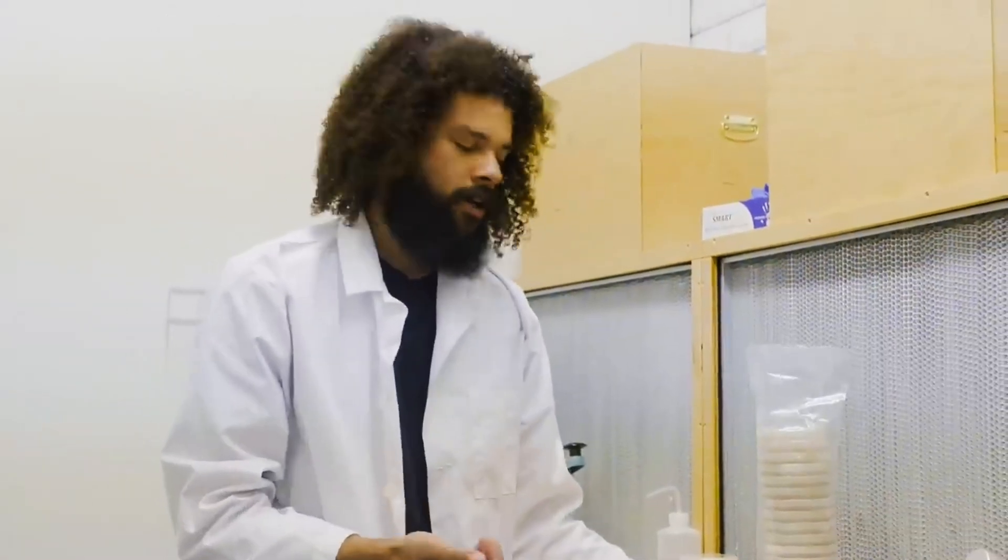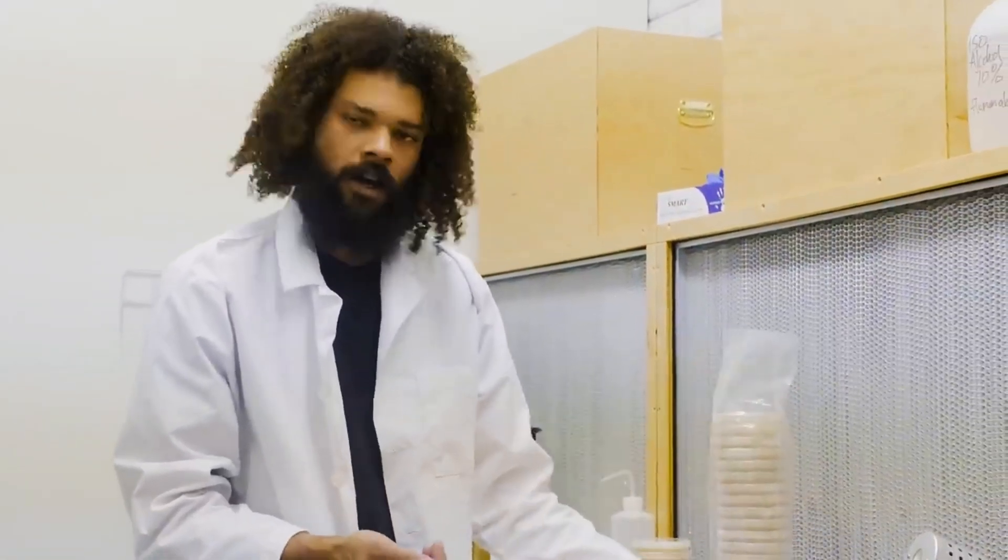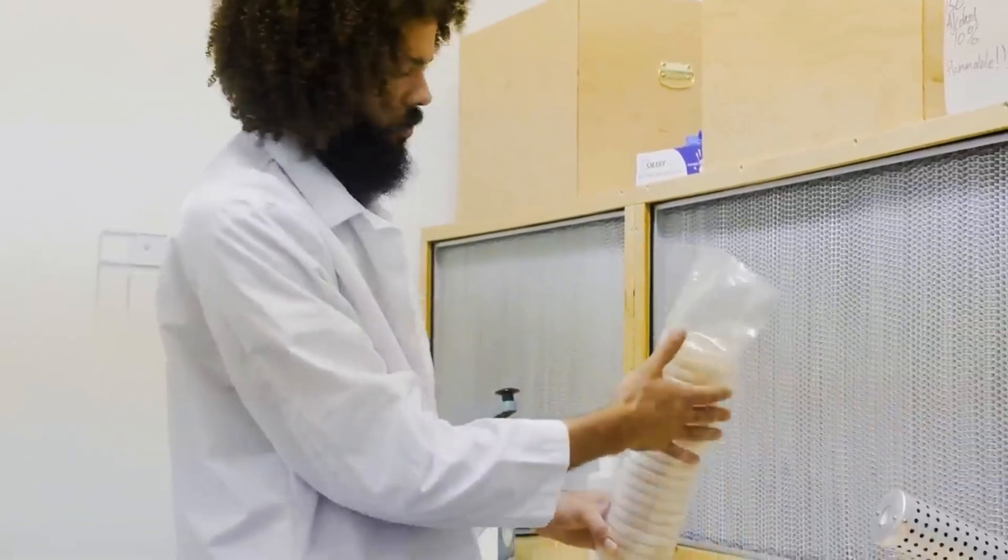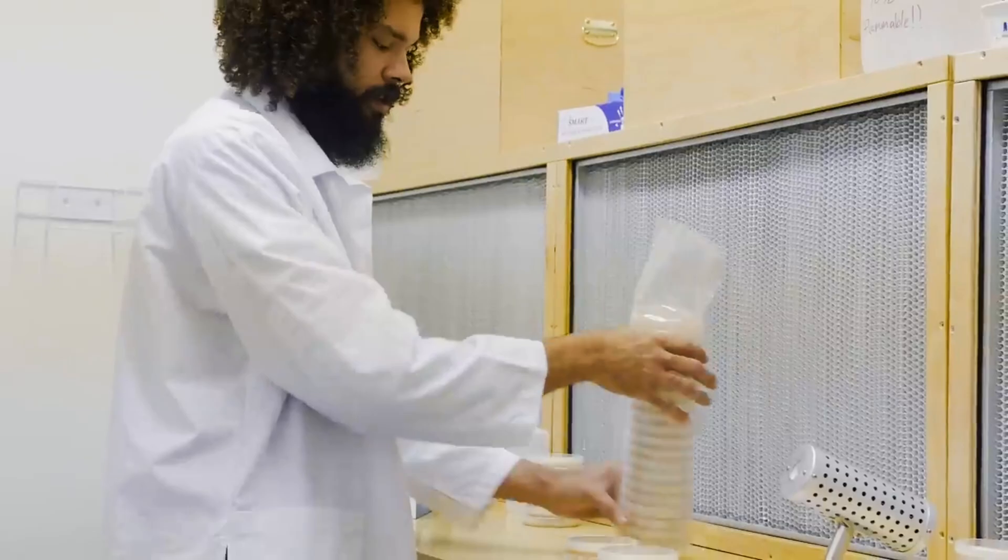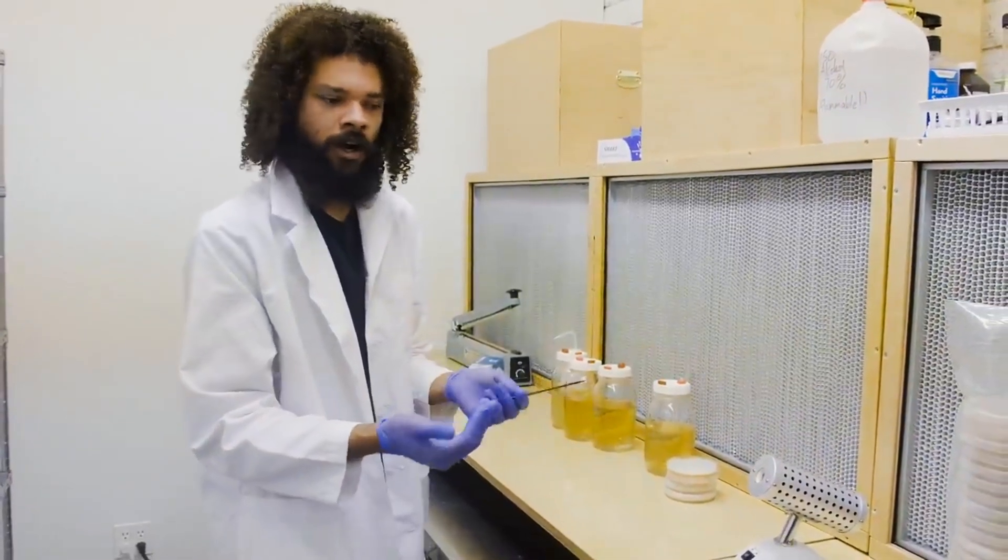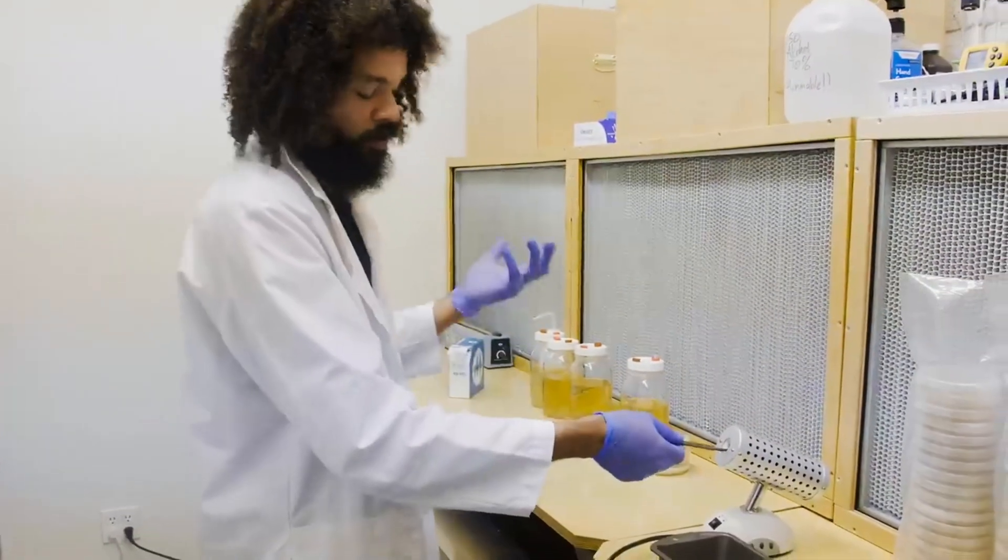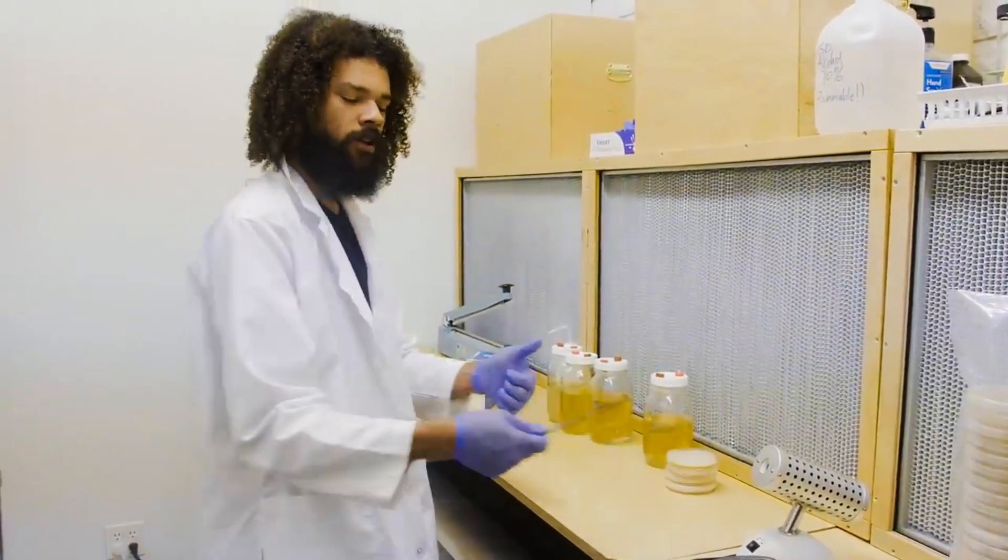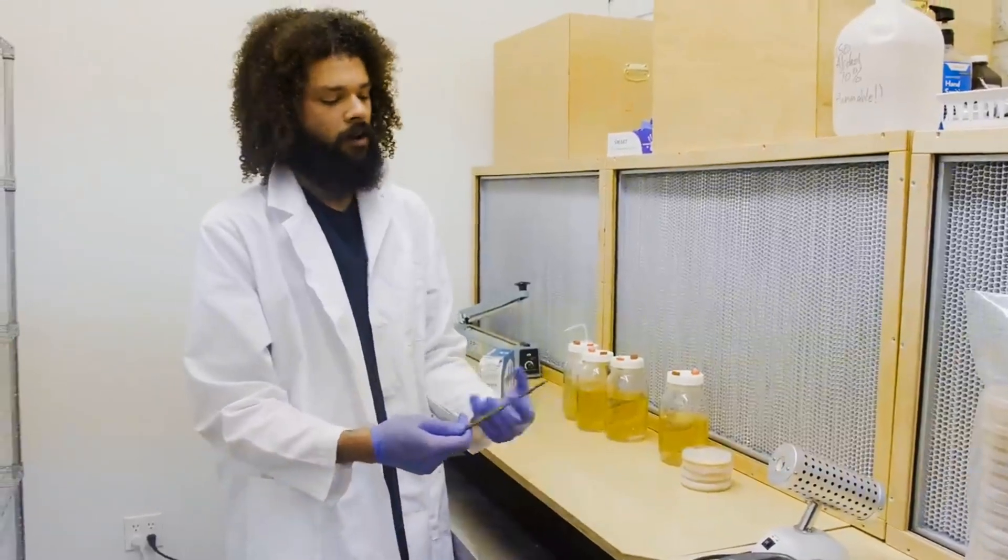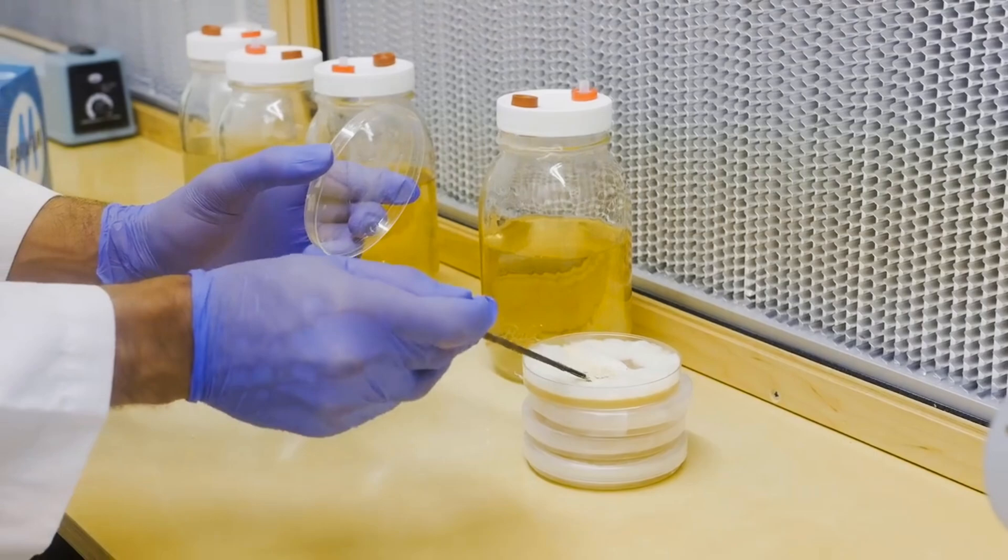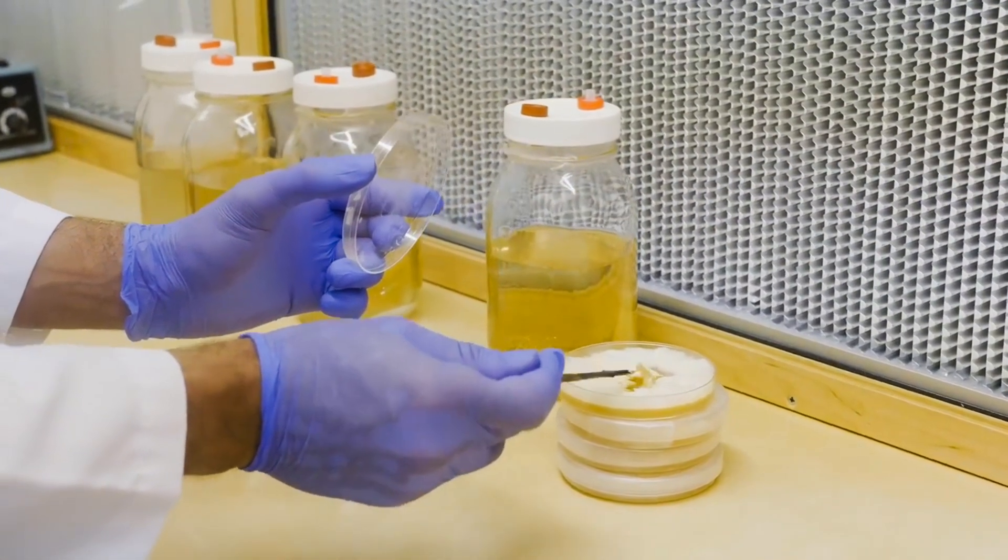After pouring my plates I use these sleeves to cover them until I need them - that way it keeps any dust from landing on my petri dishes. You can torch your tools until they're red hot and start transferring. I'm grabbing a torch or lighter. Some people use an alcohol lamp. Use the blade as a little spatula.